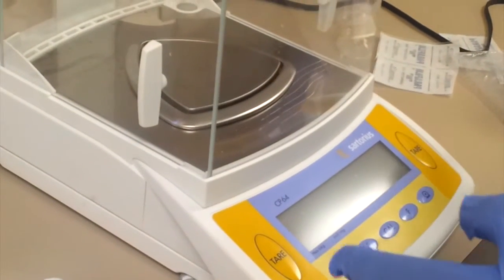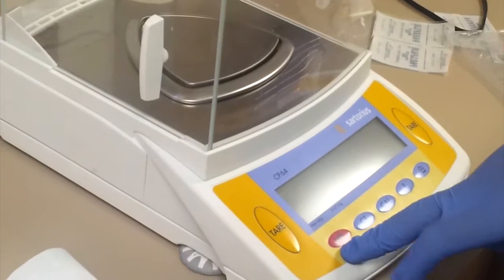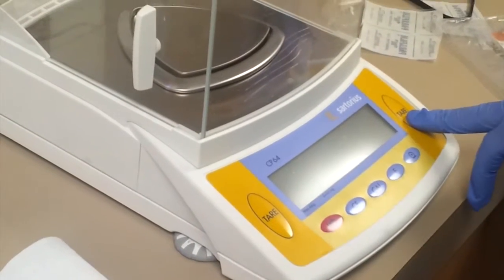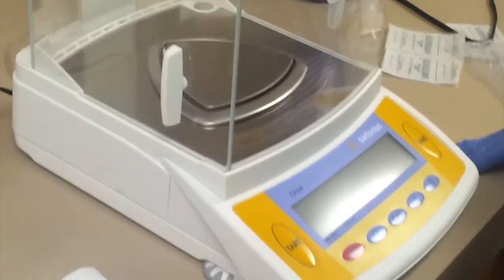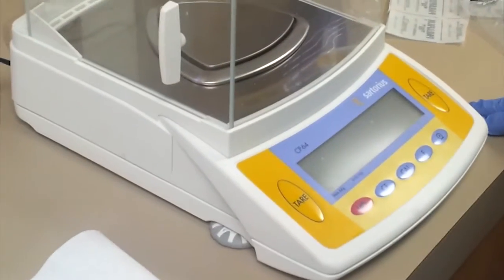This is the laboratory scale. As you can see, there's the power button and the tare button. All these other functions we will not worry about in this demonstration, since it's just the basic utilization of the scale.